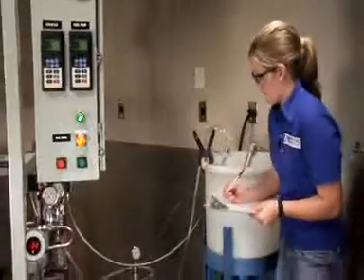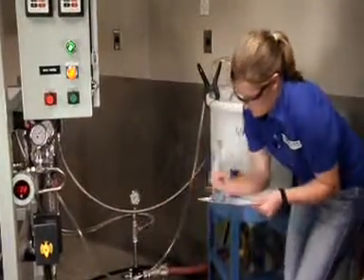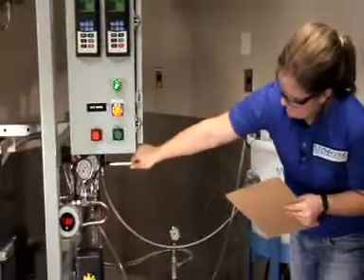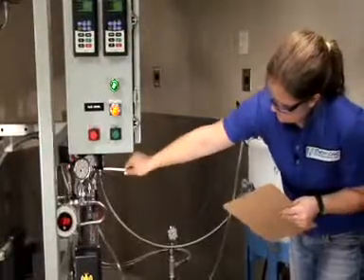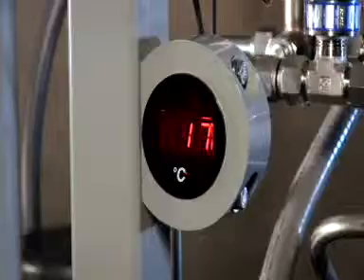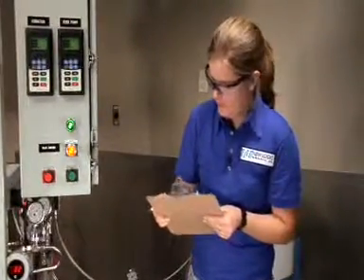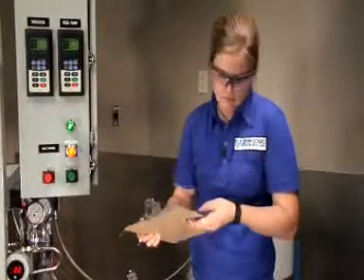Next, you'll check the feed pressure, the concentrate pressure, and the temperature of the system. The inlet pressure is read near the bypass valve at the discharge of the pump. The outlet pressure is recorded at the concentrate discharge from the VSEP. The temperature is a display on the front of the VSEP using the thermocouple that is in the feed tank. Be sure to make accurate notes of the time.